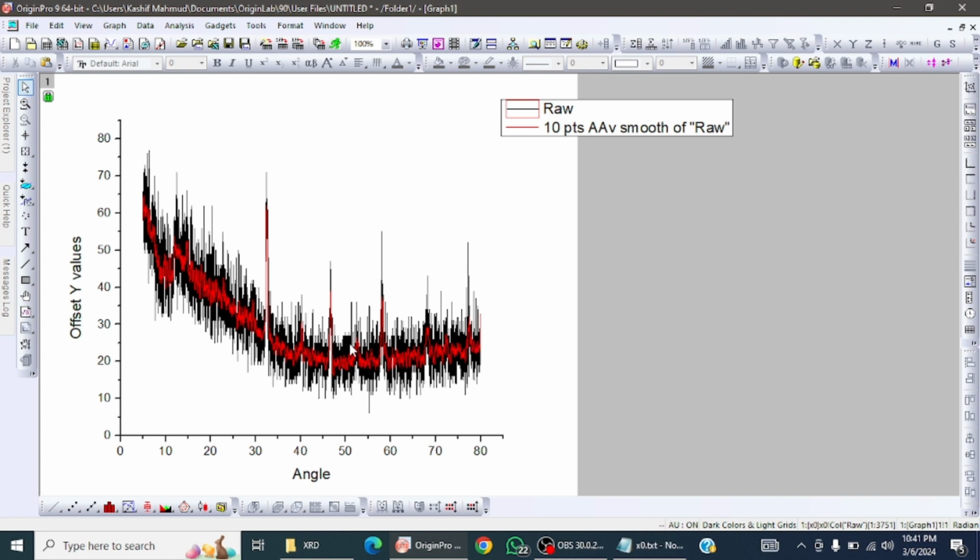So you see that the noise is removed. The black line is the initial, and now I have this red line, which is much better than the previous. So now I am going to remove the previous one.